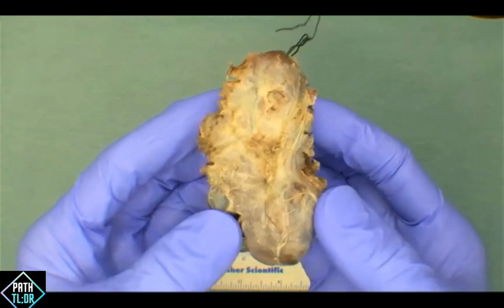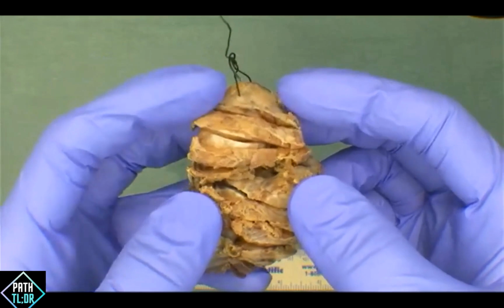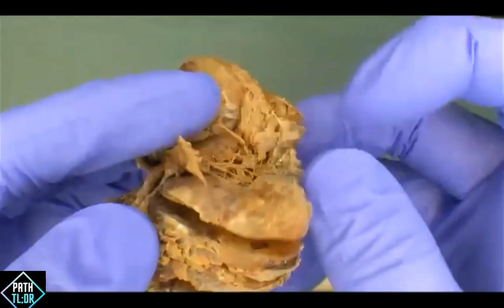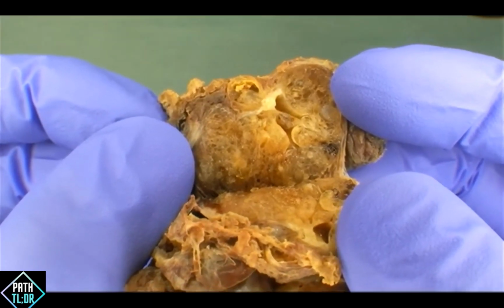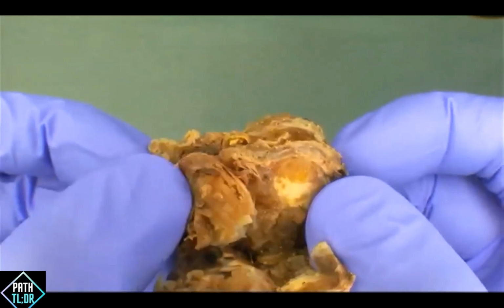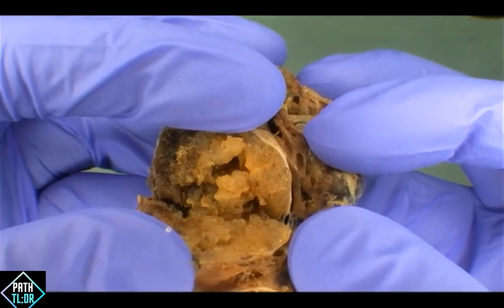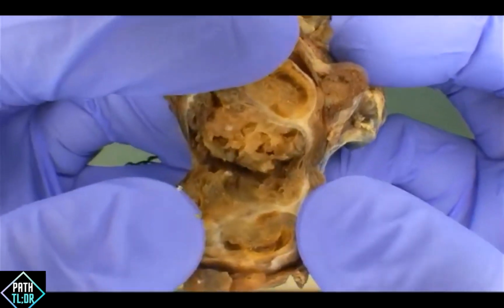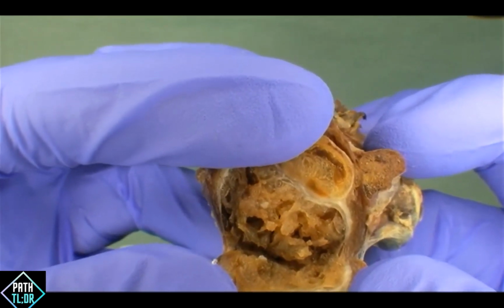Okay, let's go to the specimen now. I'm just going to show you some of the cut surfaces, and as I do, let's get some descriptors on what we're seeing. We're going to start at the superior pole and work our way all the way down. What are some descriptors of what we're seeing here? Good, we've got cystic, some fleshy, glistening colloid material. Cystic spaces, yes, absolutely. Multinodular, yep. Yes, good. You can appreciate there's a number of different nodules happening throughout the lobe here. Yes, query encapsulated, yeah, so maybe not, hard to say.